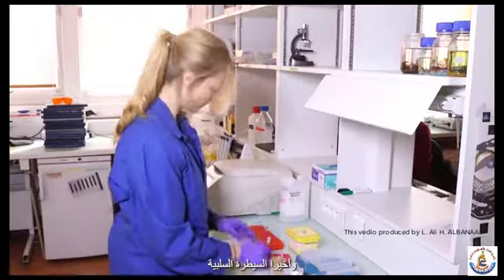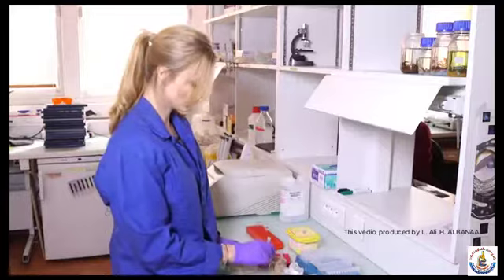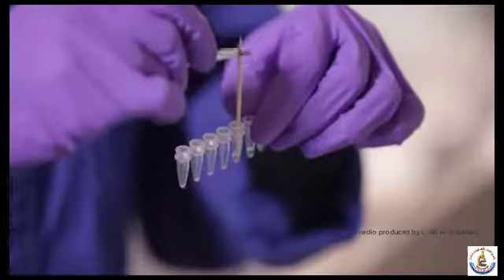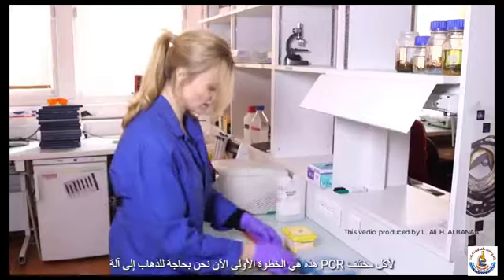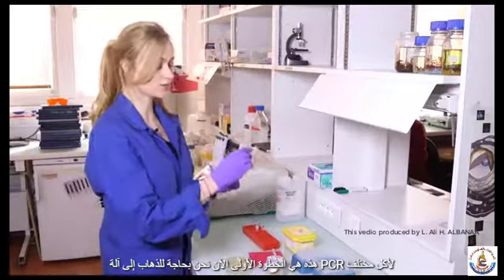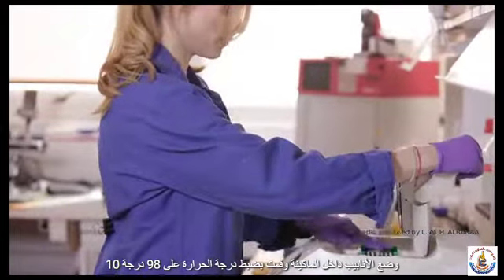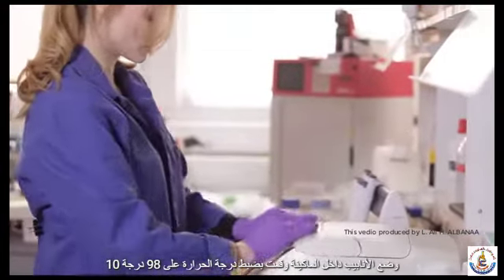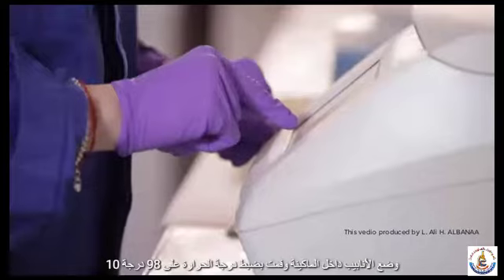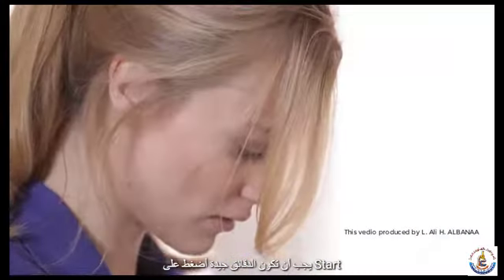And finally, the negative control. So that's step 1. Now we need to go to the PCR machine to heat the different tubes. Put them inside the machine, and I set the temperature at 98 degrees. 10 minutes should be good. I press start.